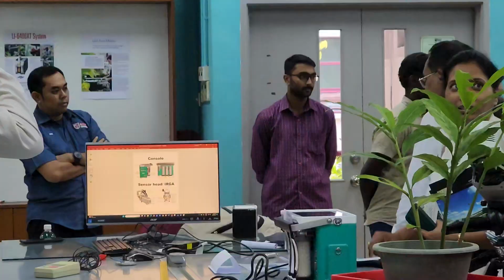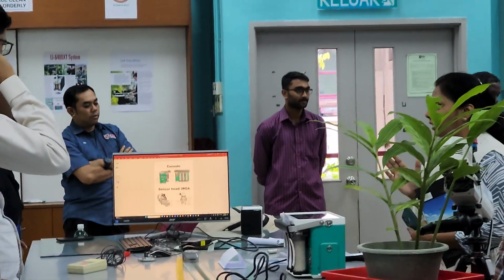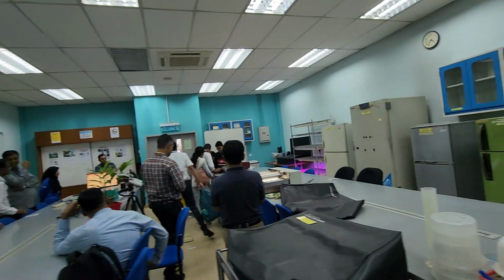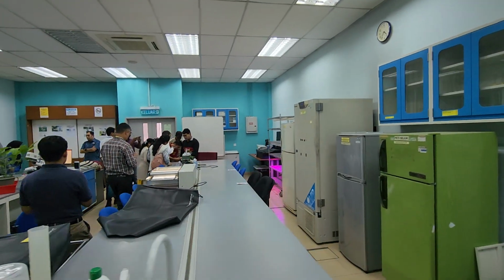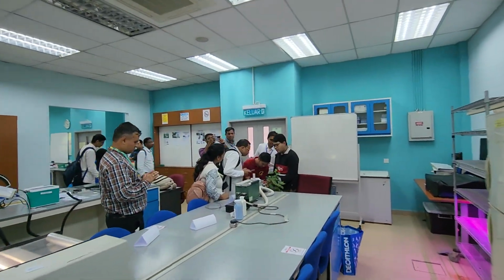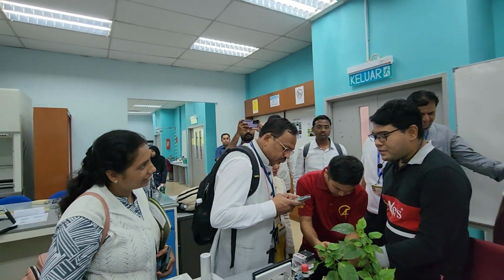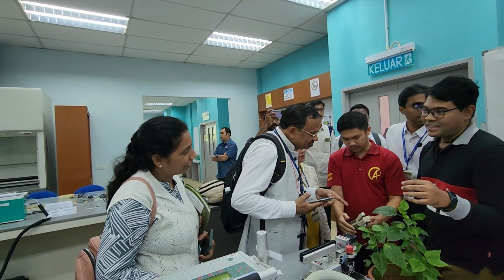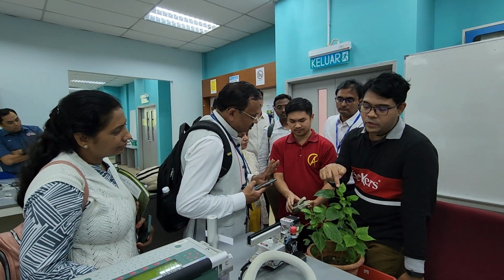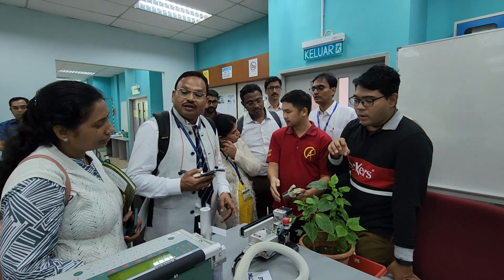So you can see that you can take two readings. This is the young leaf, so have a reading of a young leaf. How many places are you taking on this plant for accuracy? Three places, because of the statistical reason. It gives the chlorophyll content directly, depending on the leaf positioning as well. This is the total chlorophyll, not chlorophyll A.